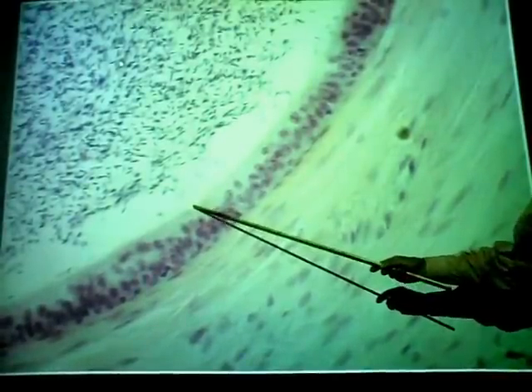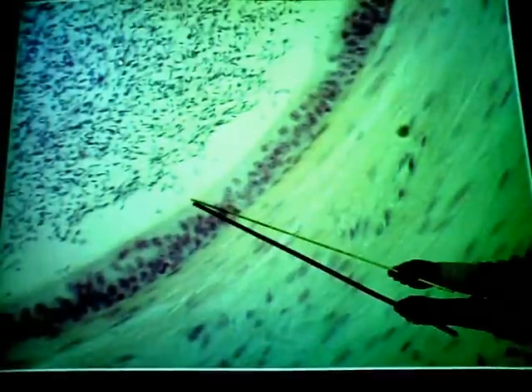It looks like pseudostratified ciliated columnar epithelium, like lining the nasal cavity, nasopharynx, and so on. These are not cilia, they're microvilli. Sort of like when you looked at the brush border in the small intestine, they looked like cilia too, but in fact they were microvilli. They increase surface area for absorption. Here it's to increase surface area for absorption of excess water and also to provide nutrients for the sperm. Again, the sperm have to be kept viable.